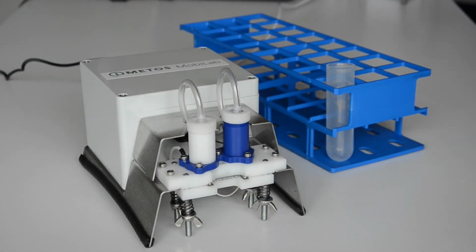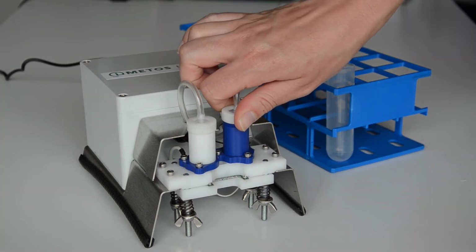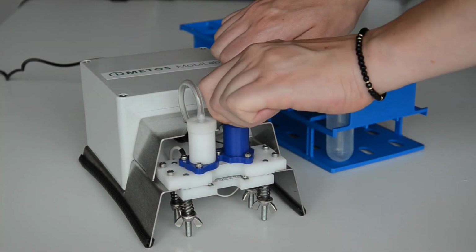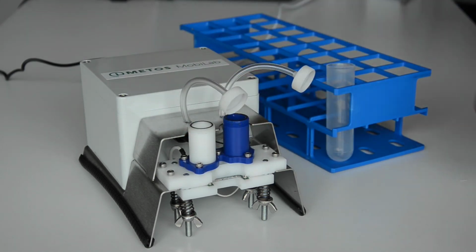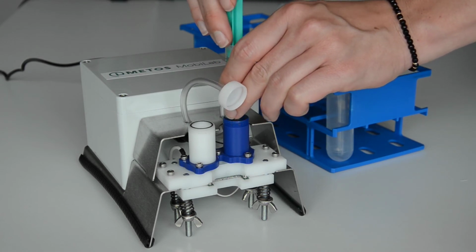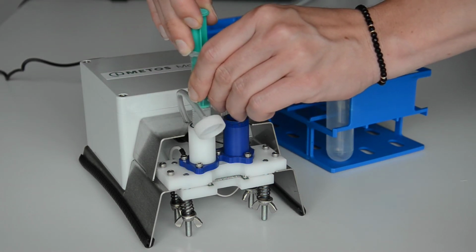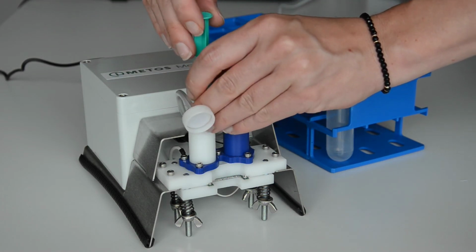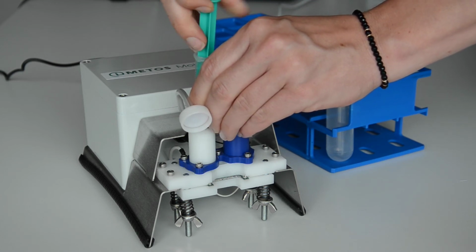To do this, all liquids must be removed from the device. The buffer containers are emptied using the syringes and the sample hole is emptied by using the pipette. The buffer solution does not have to be thrown away. It can be reused. Please refer directly to the label for the correct storage method. If particles are already floating around or the solution is very yellowish, use a new one.